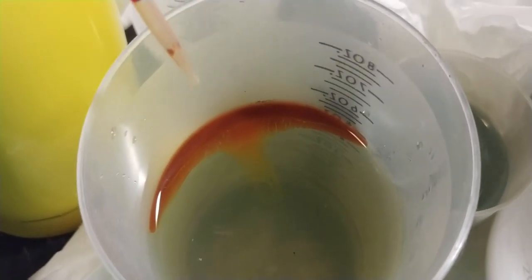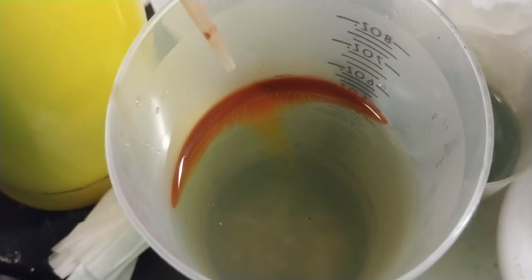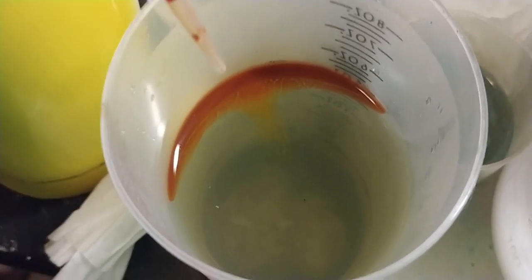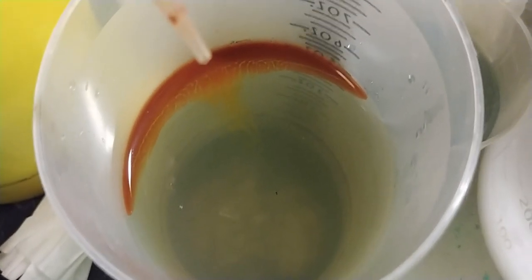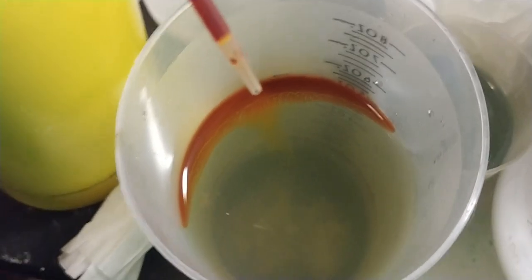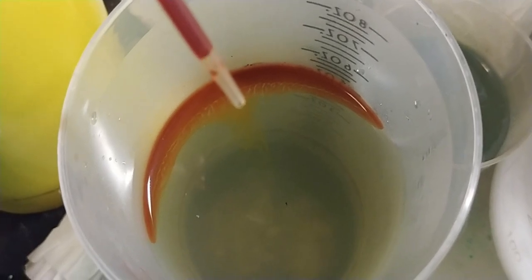Because I would call that red — as far as like iron oxide. Either way, I'm going to handle this as hazmat. I'll process it myself and encase the solids in glass.